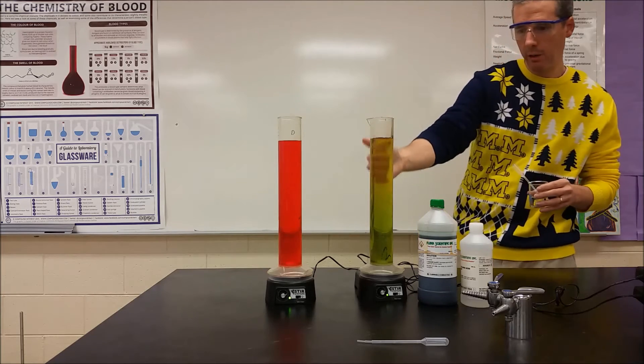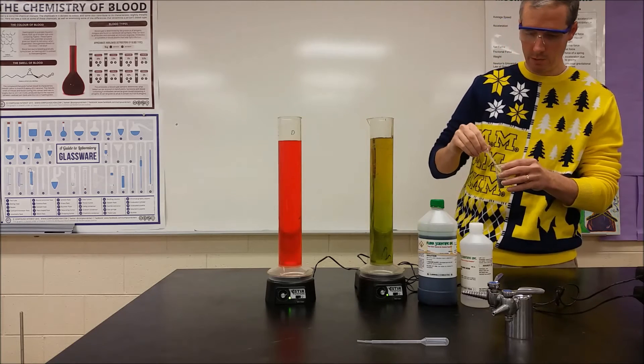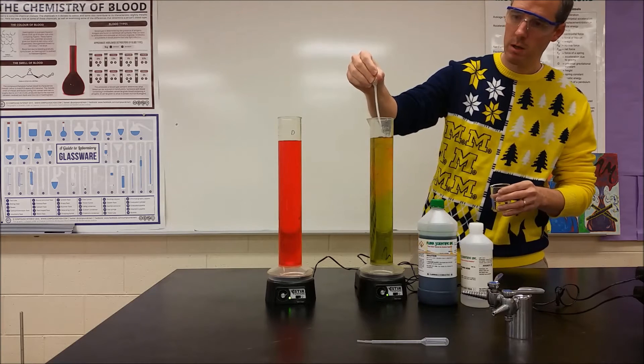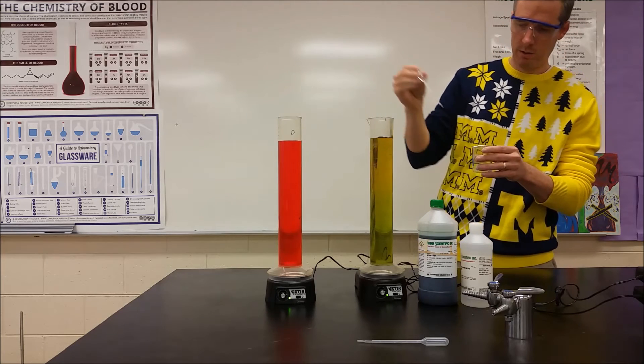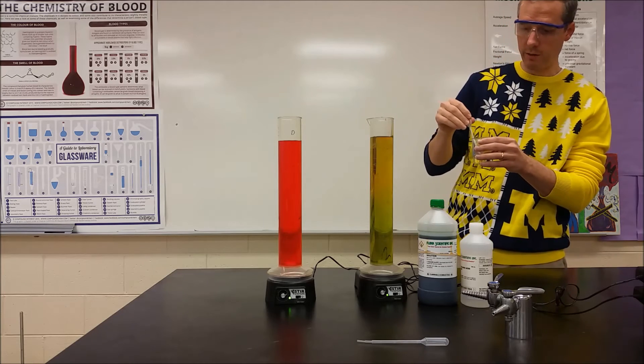So now I can see a yellow color, but it's kind of green at the bottom. So it's not fully mixed. We are getting to that point where we change. And I started with about 80 milliliters here, so we've added about 40 milliliters of acid.